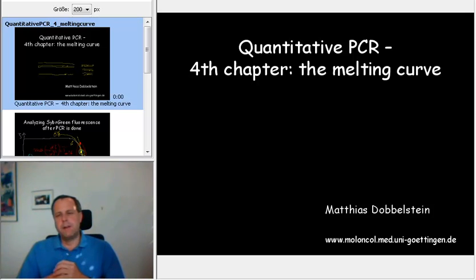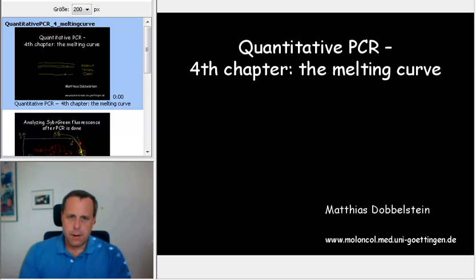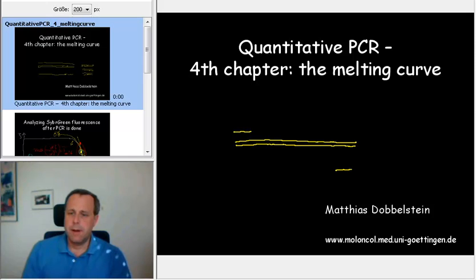So in particular, what you're afraid of when doing quantitative PCR is that you aren't really amplifying your template, but that you're rather amplifying something that we call primer dimers. So what's primer dimers? Well, it's easy enough. What you're hoping to amplify using your primers is, of course, a piece of DNA that corresponds to your template, something like that. That's what you're hoping. But if you didn't design your primers well, or if your PCR conditions weren't right, what you get instead is something like that.